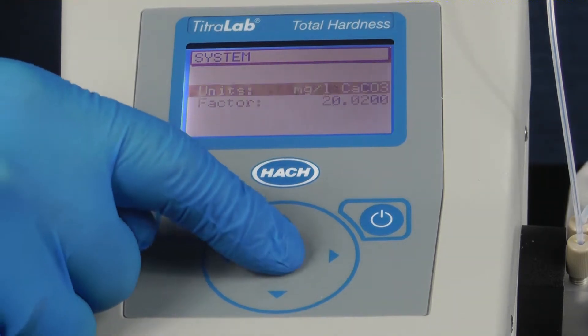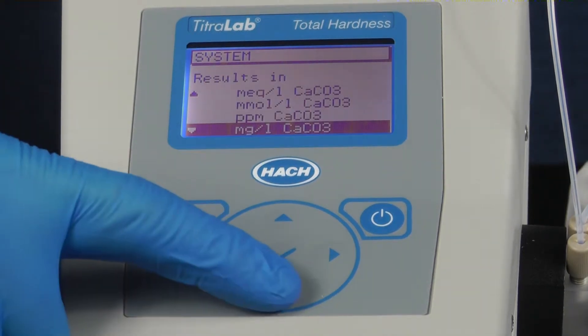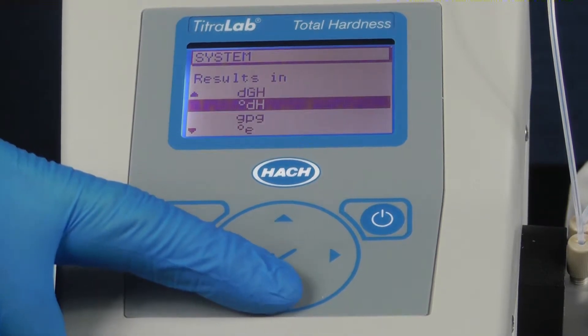You may select a different unit for your results to be displayed according to your needs.